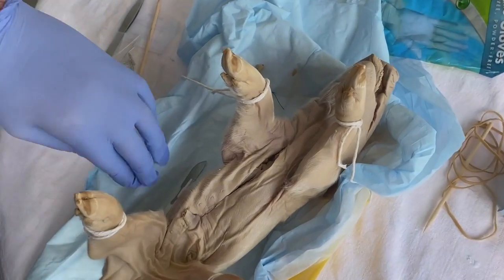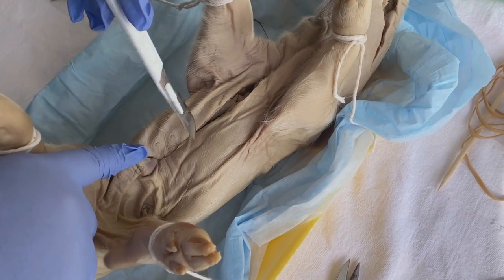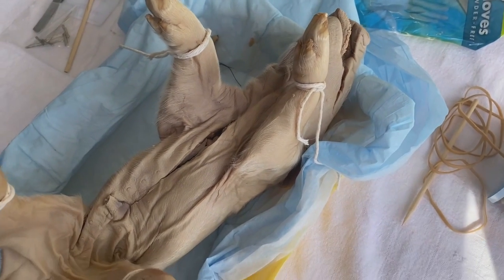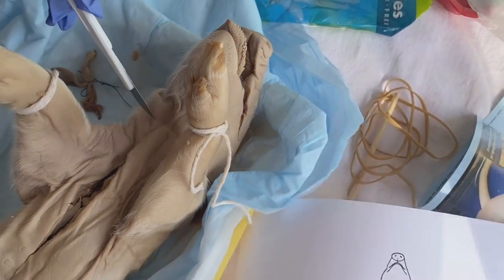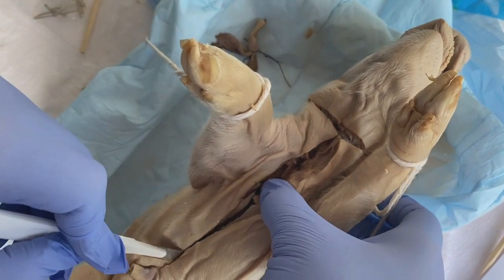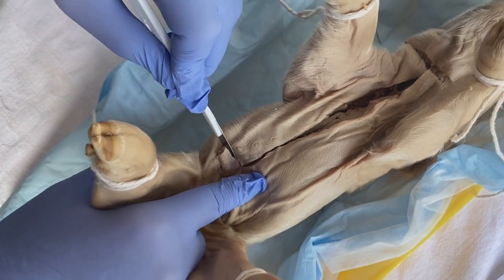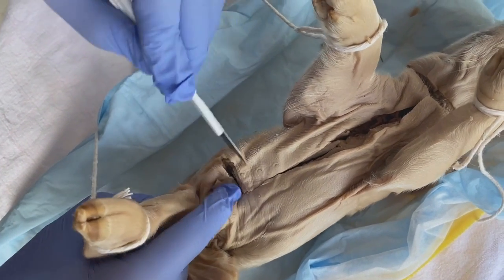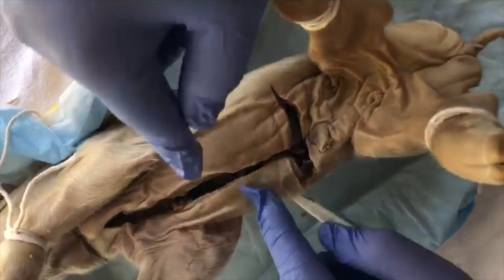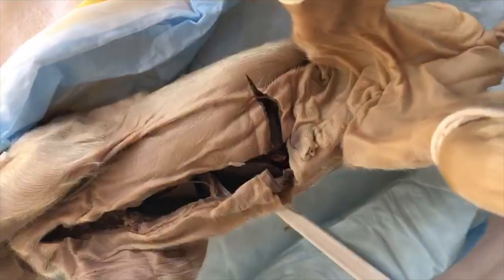So now, following the incision that we made from the umbilical cord just to the top of the neck, we now need to make 2 other incisions right here on the side of the neck. But then a similar incision must be made here. Alright, so now that we made an incision down the middle, here and here, we need to isolate the diaphragm, which is right here.